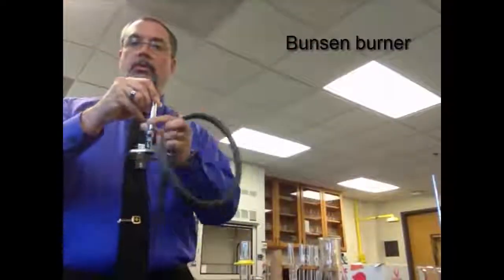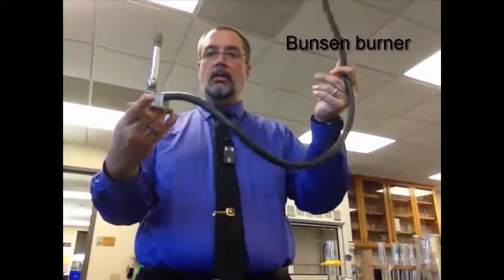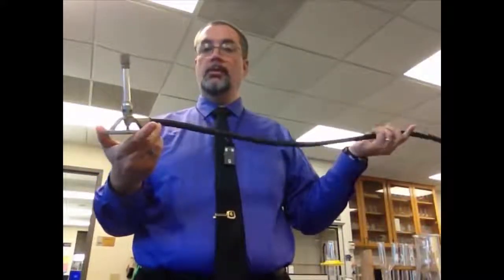So, we can heat liquids in beakers, we can heat solids in crucibles, we can do chemical reactions in test tubes or in Erlenmeyer flasks. What if we want to heat something? We keep talking about heating things. How do we heat things? Well, we're going to use something called a Bunsen burner. Here's a Bunsen burner. A very famous structure here in chemistry. We use these Bunsen burners to heat things all the time.